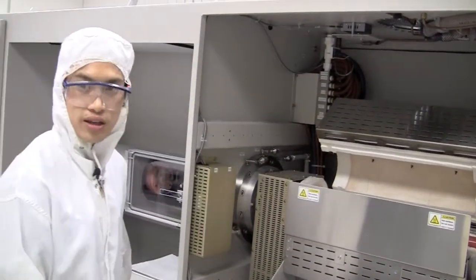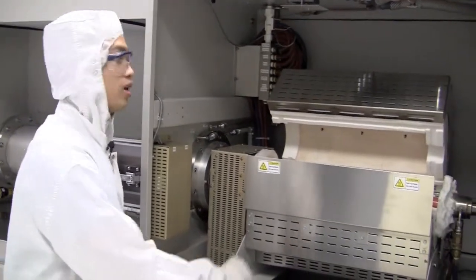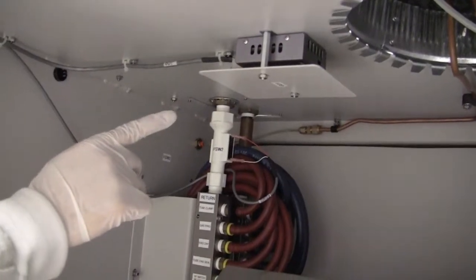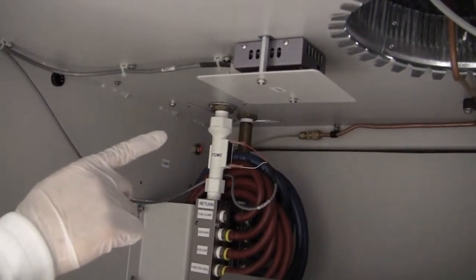One final thing, as a safety mechanism, there is a built-in gas detector above the furnace. This will tell us if we have any gases leaking from the quartz tube.